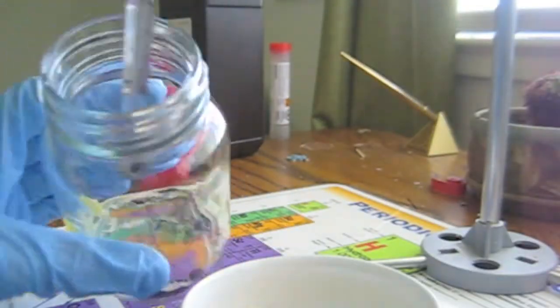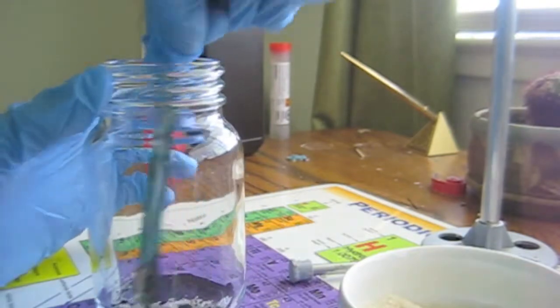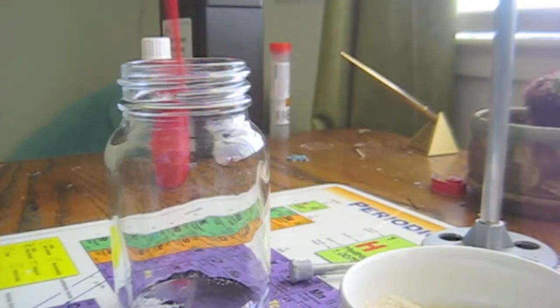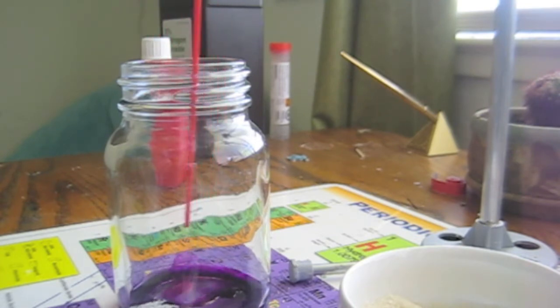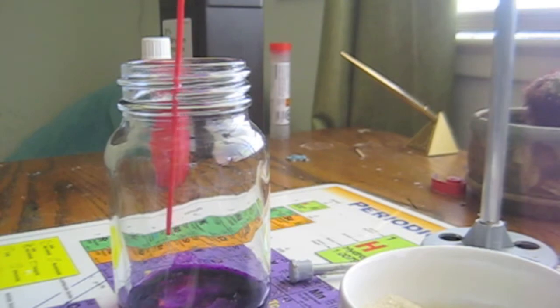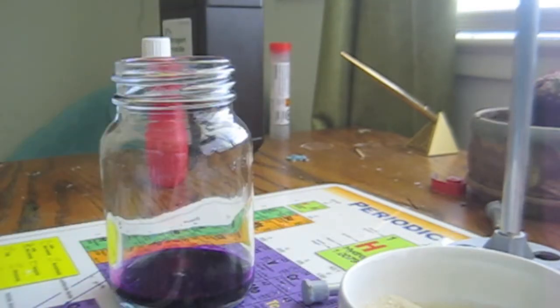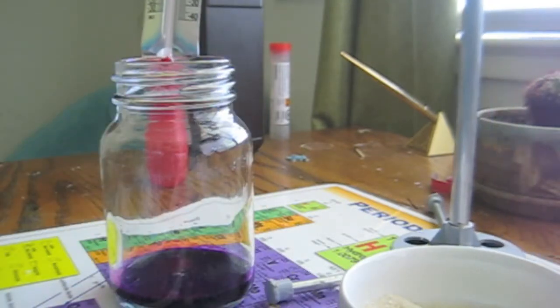Now I'll add five milliliters of water, and it turns really dark purple. I think that's enough because it covered it. Now I'm going to put in a thermometer.